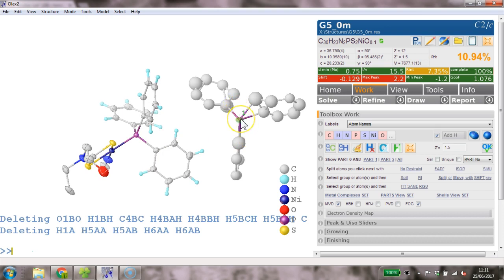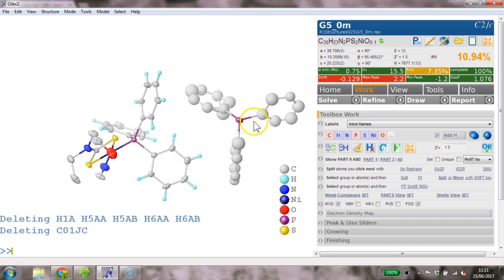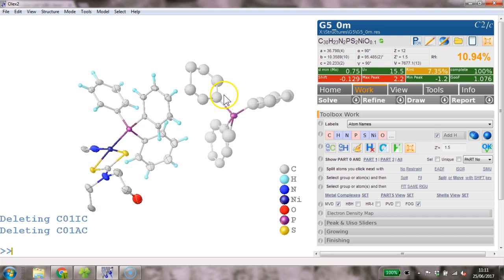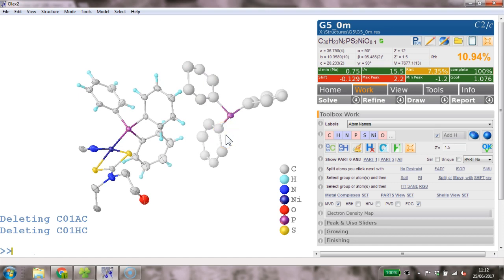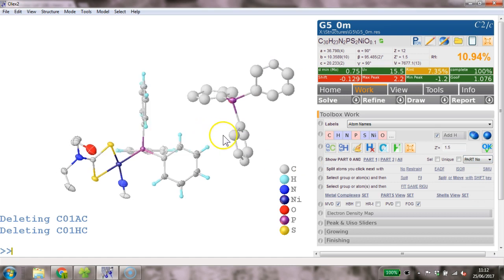And up here I would do the same. We go part 0. Now here we know it's going to be disordered, so I'm going to set the occupancy to 0.5, but I'm going to fix it, so it's 10.5 to fix the occupancy to 1/2. Then I would tidy up these carbons, so we end up with a healthy looking triphenylphosphine without dealing with the disorder at all. So now we've got the raw thing. We shouldn't have any parts anymore. That's also shown here. So the occupancy is all set to 1/2 on this, 1 on this, and we have no part assignment whatsoever.